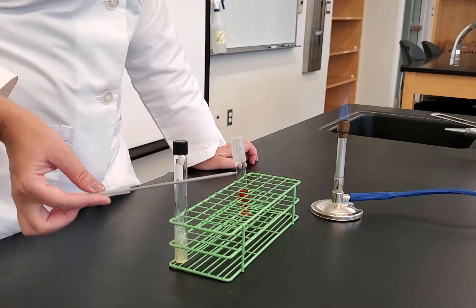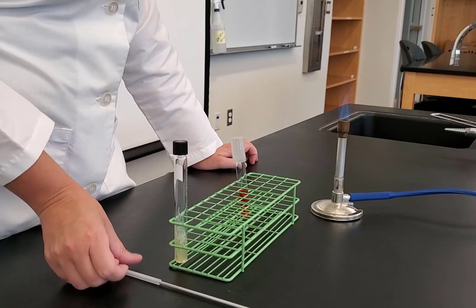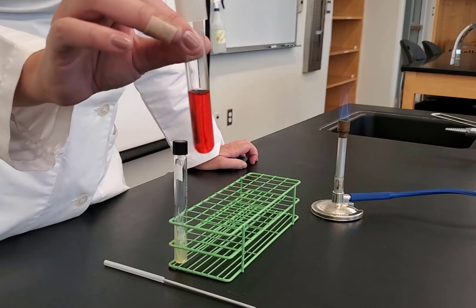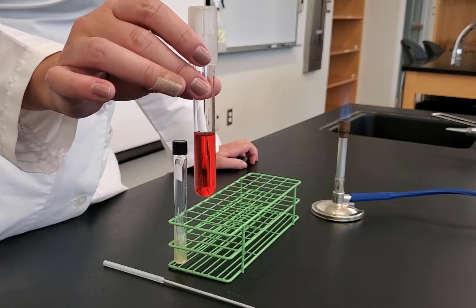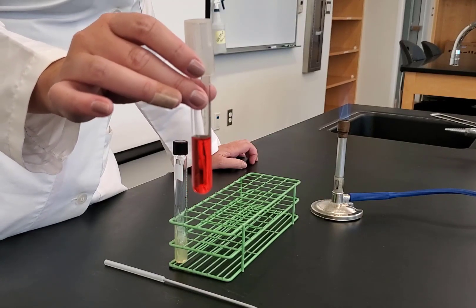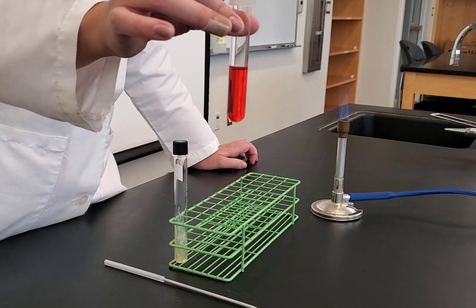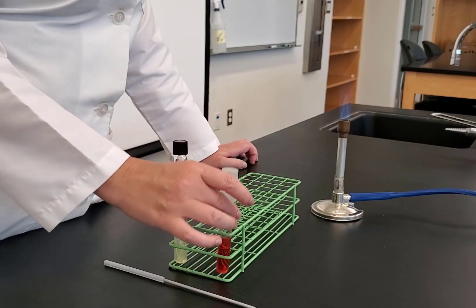Notice that the loop was in a broth before. When you flame sterilize afterward, be careful not to splatter — that's why you start at the base and work toward the loop itself. For each organism, you would inoculate two tubes: one with the plastic cap containing glucose and one with the metal cap containing lactose. Because there are four organisms total, you would inoculate eight tubes. Then put them in a can and place them in the incubator for 48 hours before reading the results.